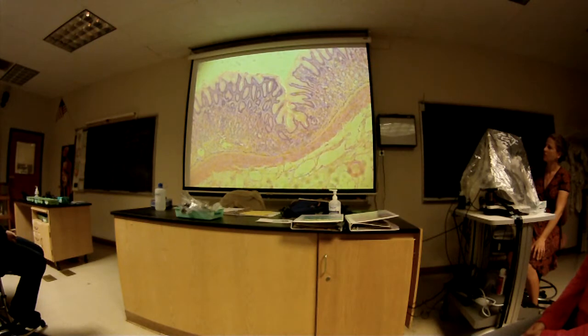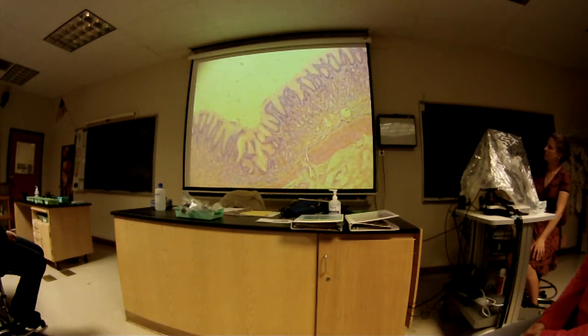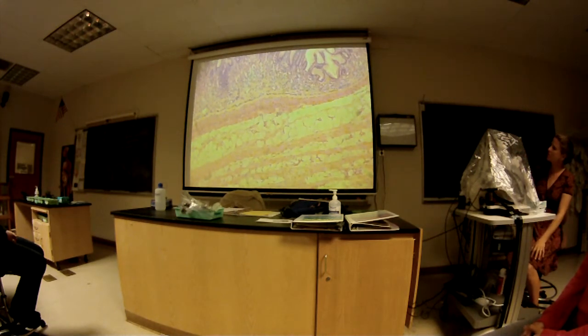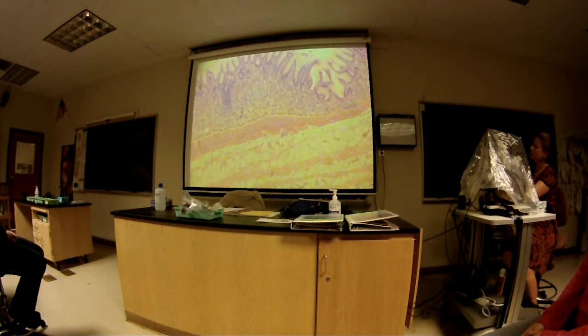And we're seeing the rugae on the other side? Is that like cutaways of that? The rugae is a macroscopic structure. See how it kind of goes up and then goes down. If you had a lot of that far away, that would look like a fold. Okay, well this is pretty visible. This is a sublayer. What's this sublayer here? Muscularis mucosa. That one's well defined there. I think that's pretty much it for the stomach.